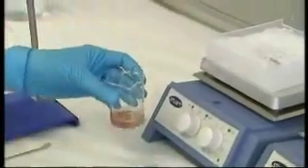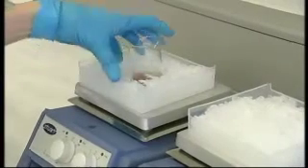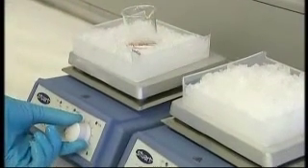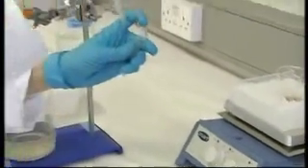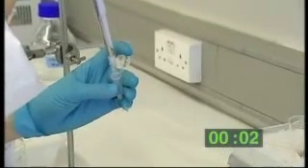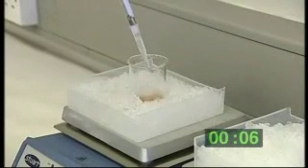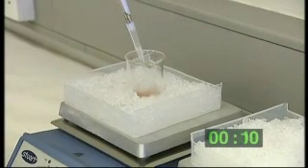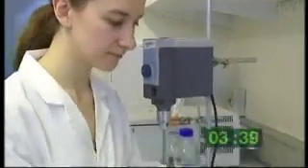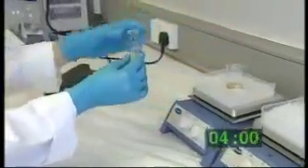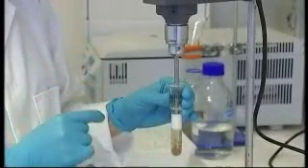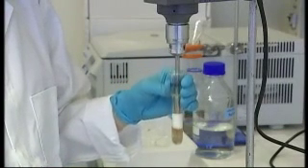Transfer the washed tissue into 20 ml of washing buffer and place it on the water ice bath on the magnetic stirrer. Add trypsin solution under constant stirring and start the timer. After brief incubation, homogenize the suspension portion by portion a little at a time using a small loosely fitted glass teflon homogenizer.